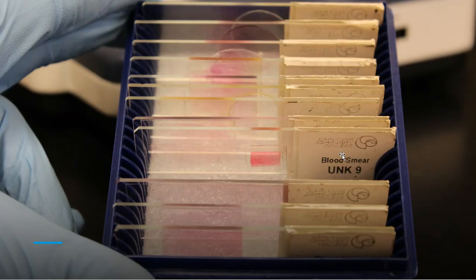Do I have the top of the slide? Do I have the bottom of the slide? So I have written the word top on the top piece of the slide, and that is the piece that needs to go toward your lenses. So just keep that in mind when you begin to pull these slides out. Pay attention to that labeling, because we did that for a reason.